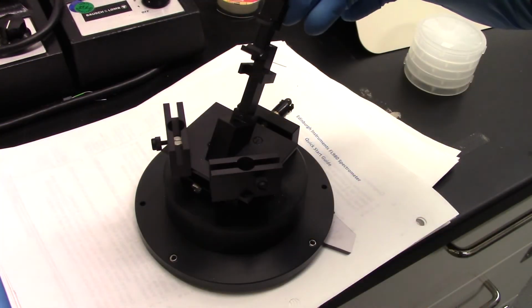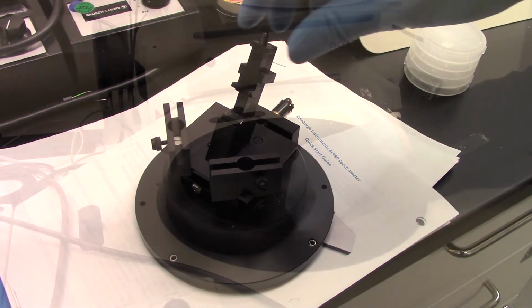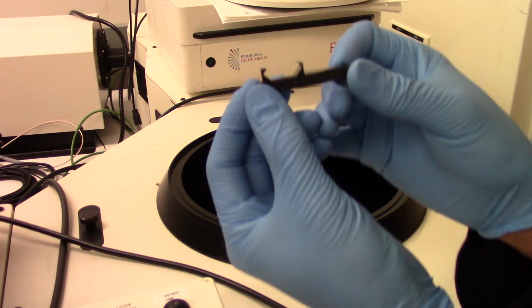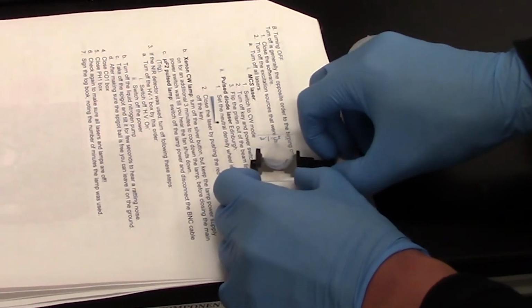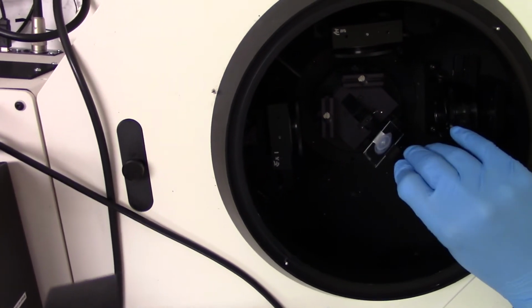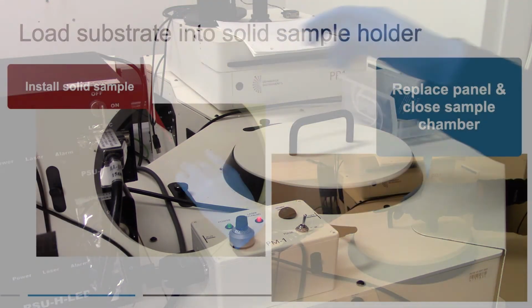The solid sample holder has a second piece that's a clip that can clip onto a glass slide or a cover slip. You can see me clipping in this cover slip that has my dried sample into the clip assembly, and then I can slide this clip into the angled solid sample holder base. Once I do that, I'll close up the sample chamber.